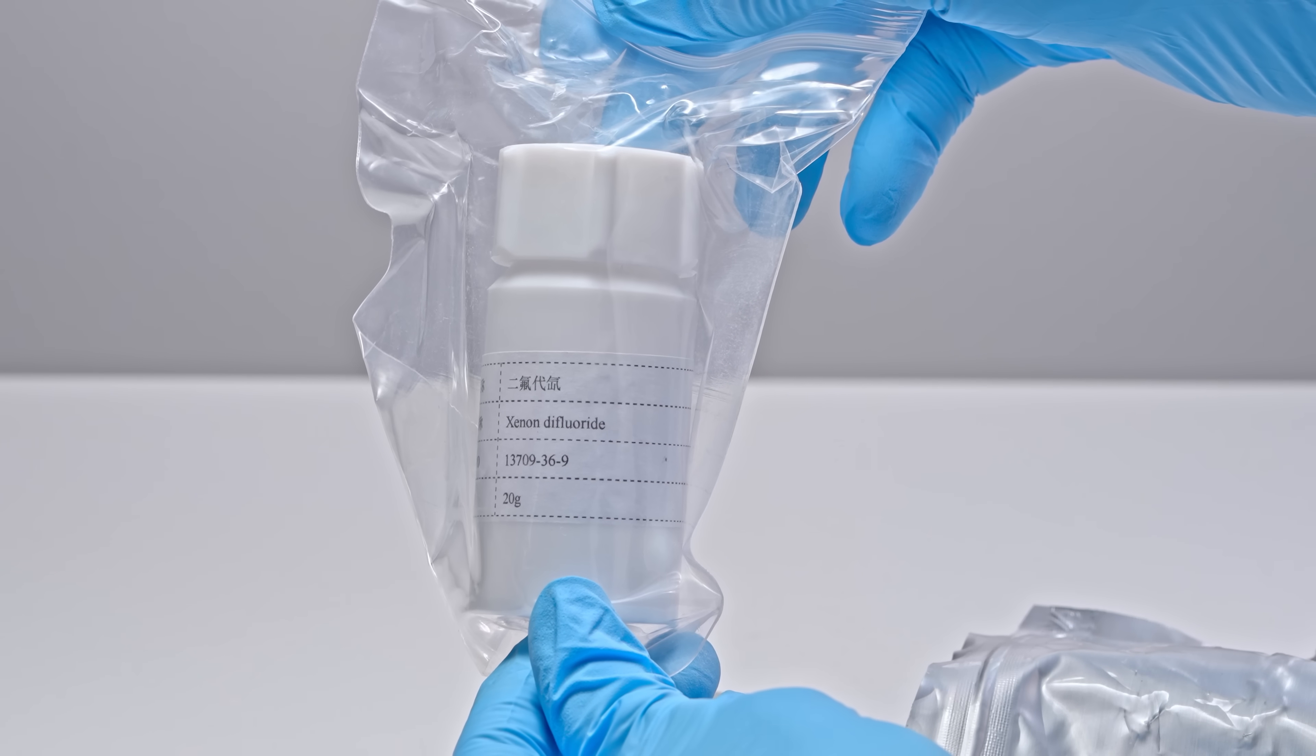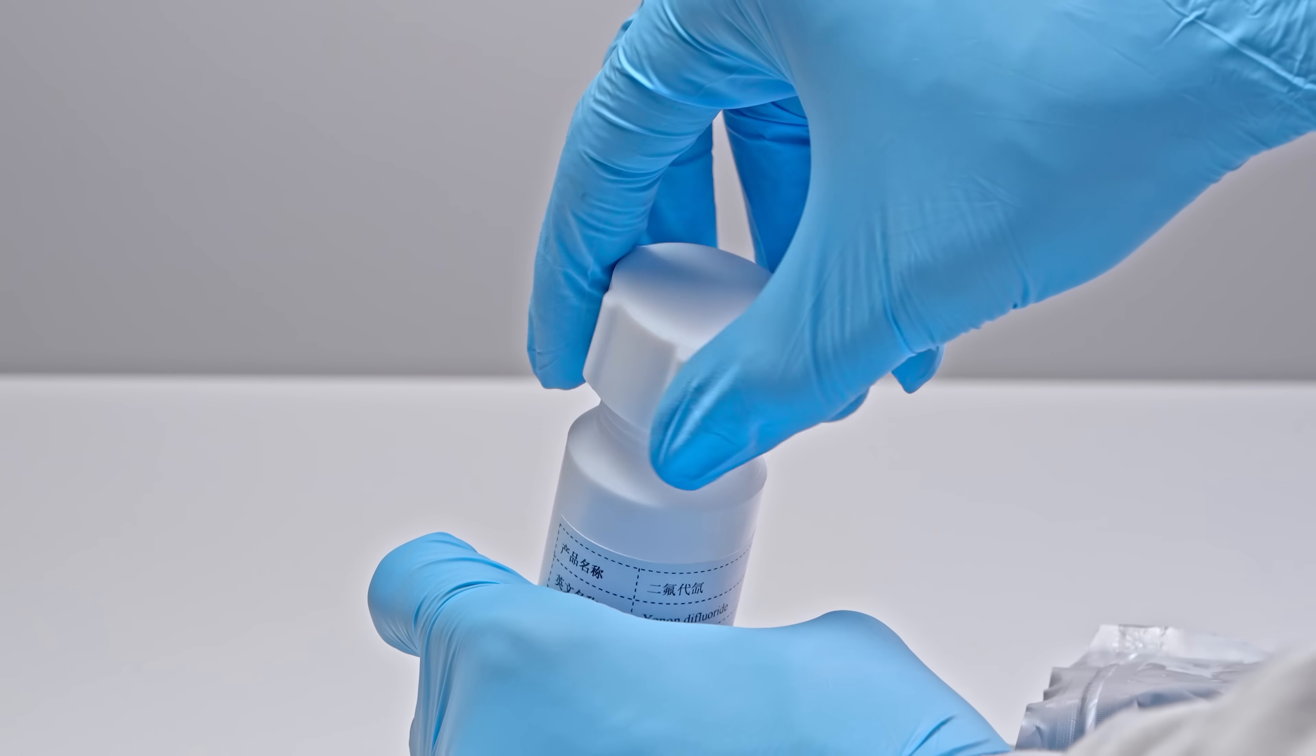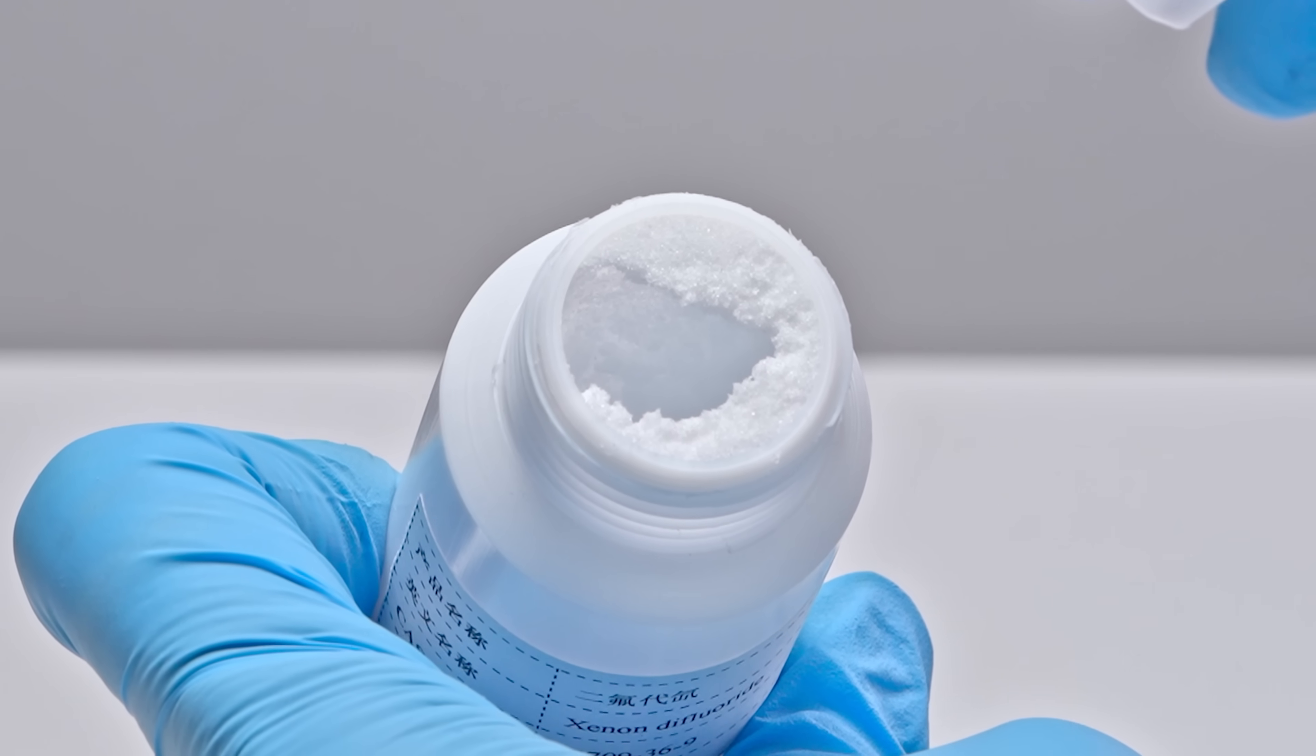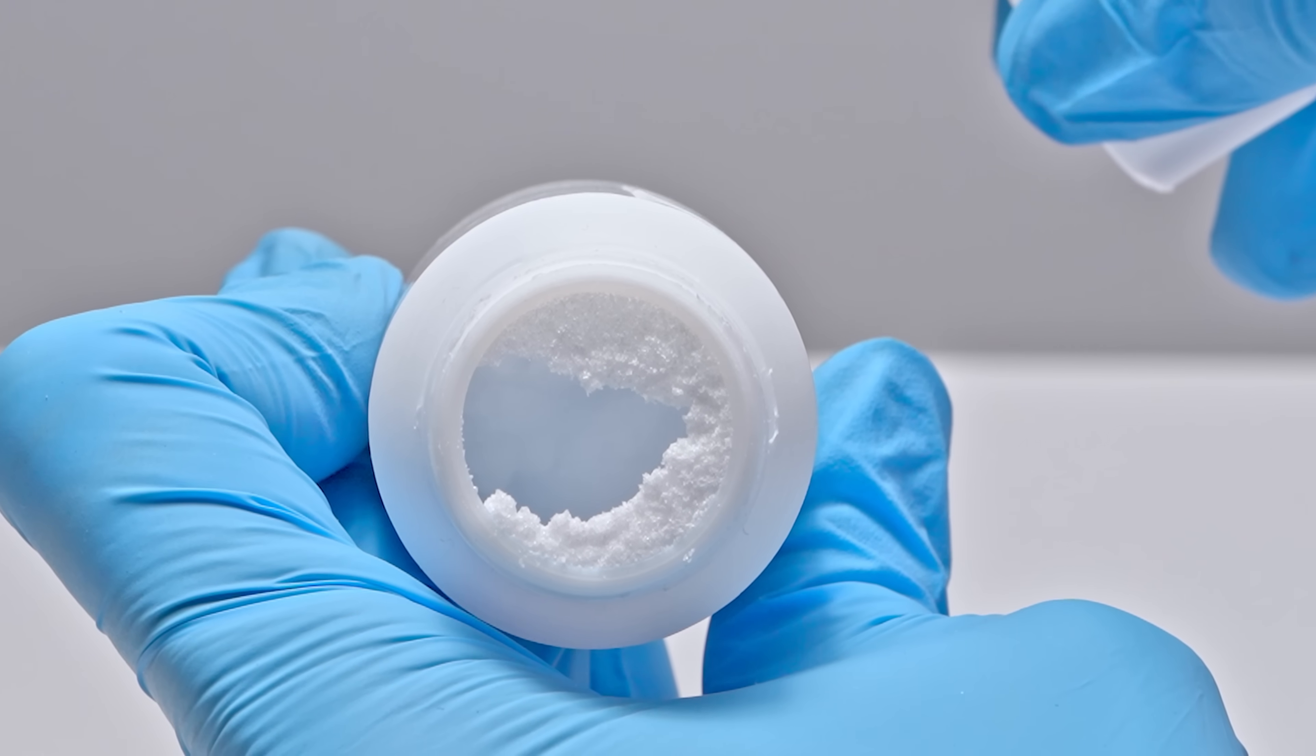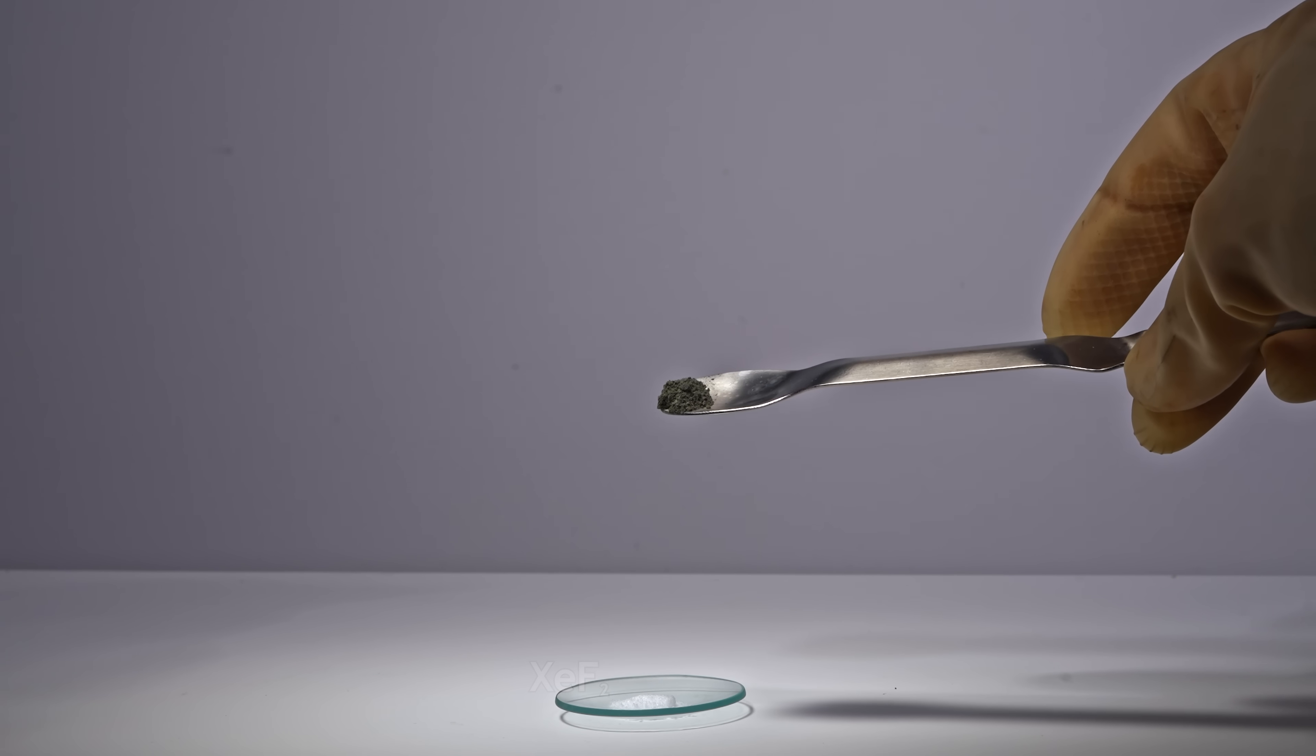I was also working with xenon difluoride for my new video while filming, so I tried it with siloxene too. I put some xenon difluoride on a watch glass and added siloxene, and of course it lit up right away.